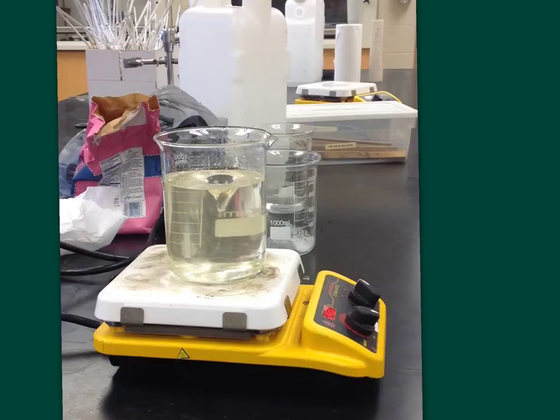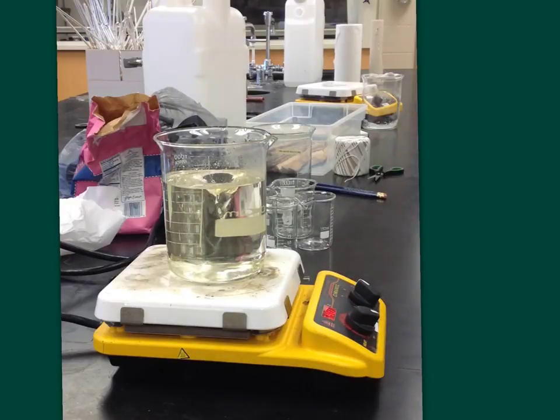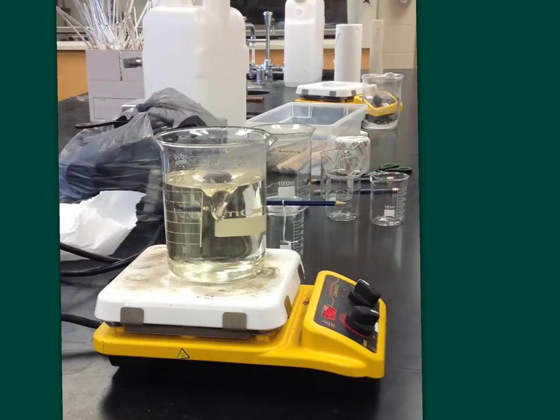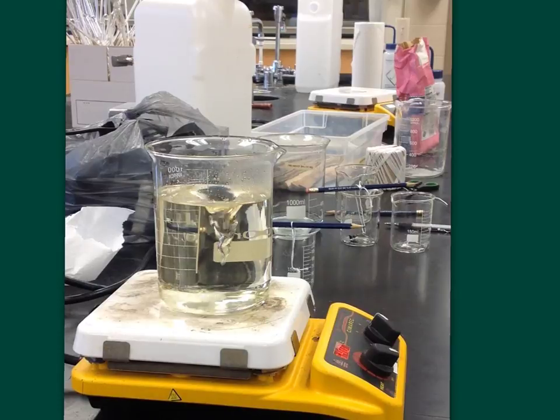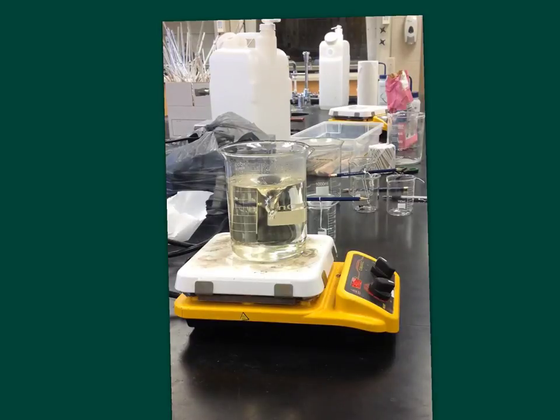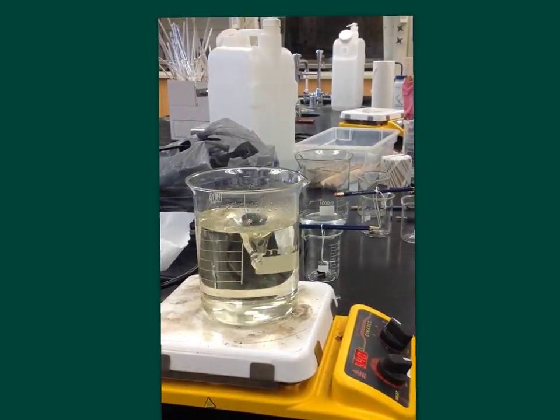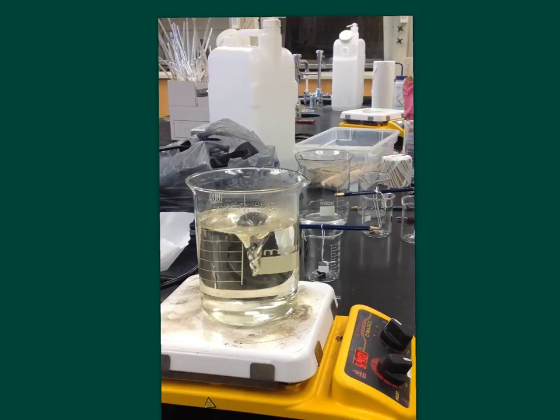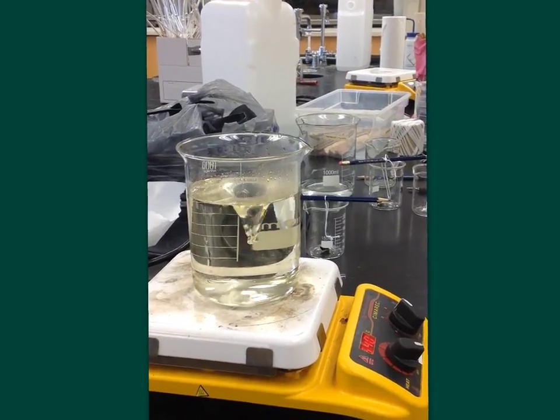And now for the miracle of time lapse photography. We see the sugar solution becoming clear. And we can see me prepping some things in the background. But even that gets kind of old after a while. So let's even fast forward even farther ahead. All right. We're out of time lapse again. Because as you can see, my solution is now really, really nice and clear. You can't really see any particles. You see some, perhaps, some little bubbles of water there. But it's more or less now particle free. Because all the sugar has dissolved.